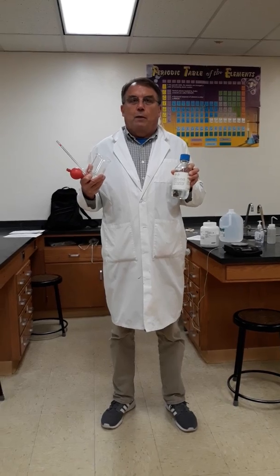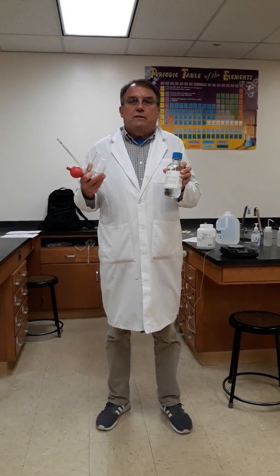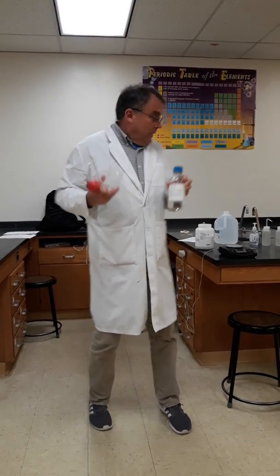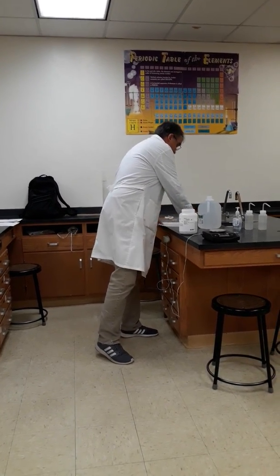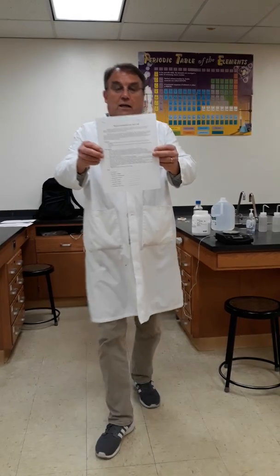Alright, so this is the first version of an attempt at a video laboratory. It'll be on molarity, a molar concentration of an acid. So this is the lab you're going to want to be looking at.